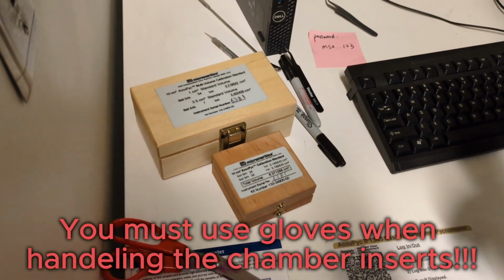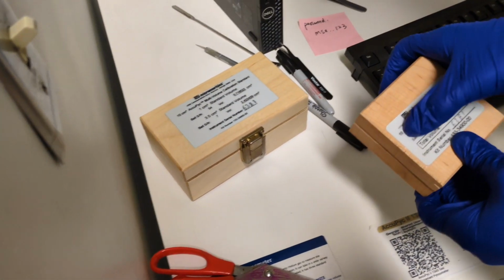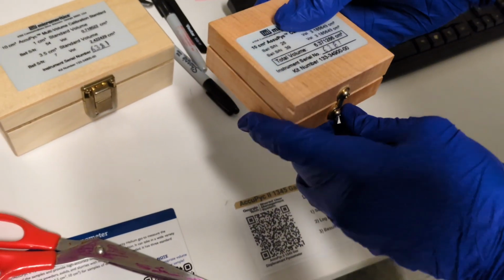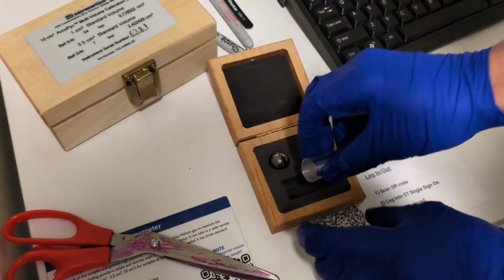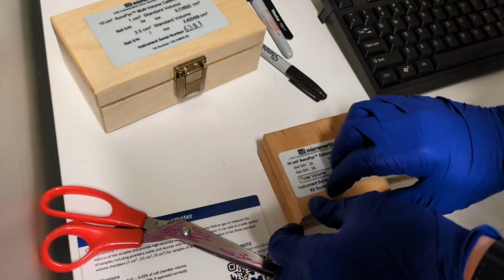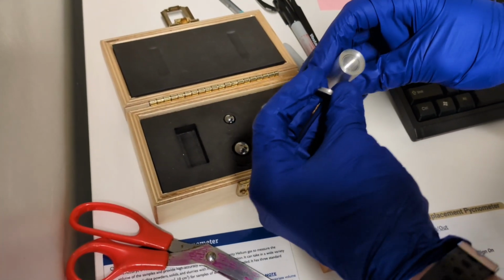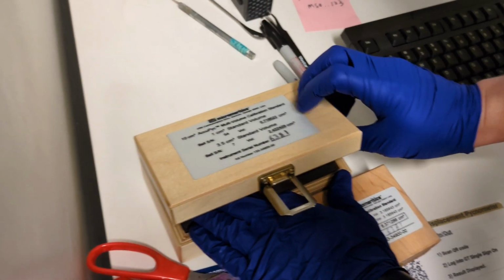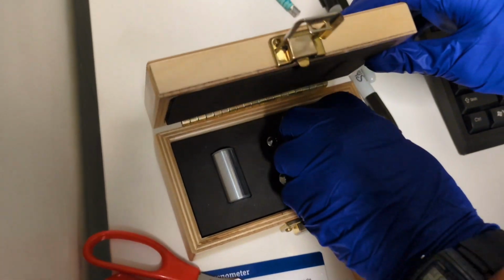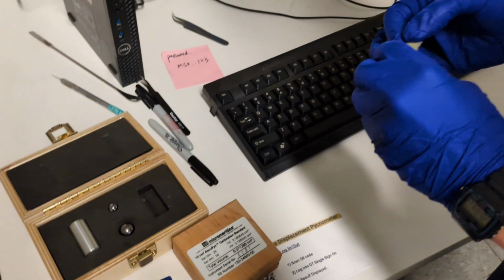So we have in these wooden boxes a couple different sample chambers. It says right here all of them. This one is the 10 centimeter cubed. You can see right here is our sample cup for 10 cubic centimeters. And then over here we have inserts for, this is 1 cubic centimeter, I believe, and the other one is 3.5 centimeters cubed is what this one is.